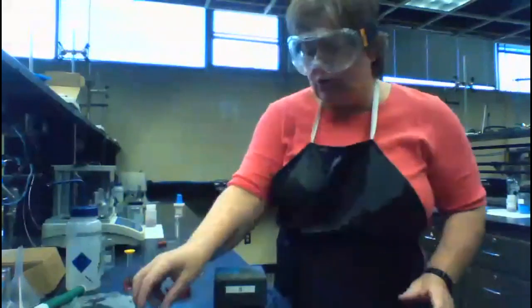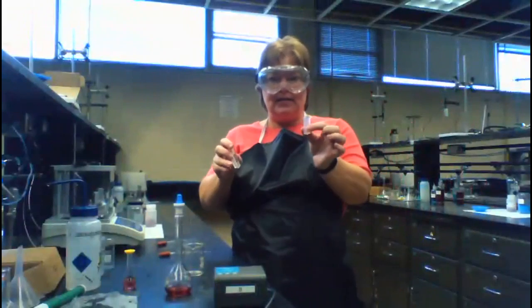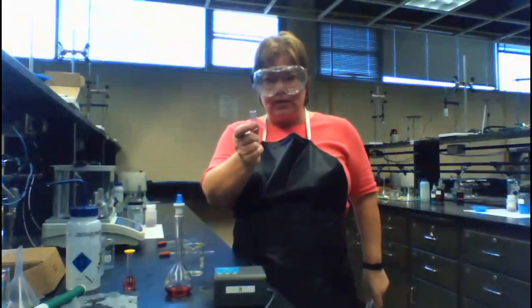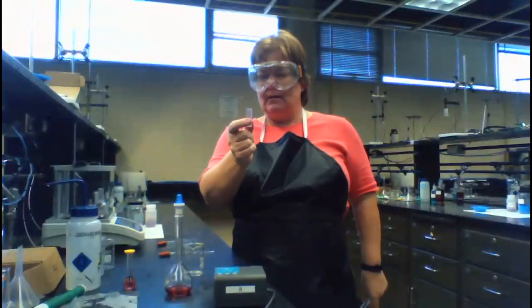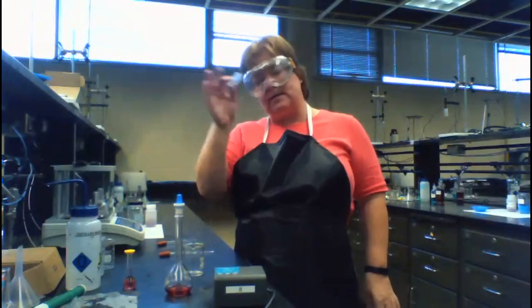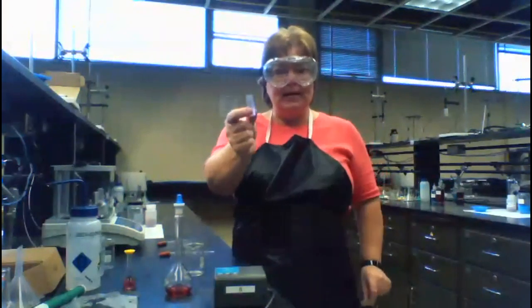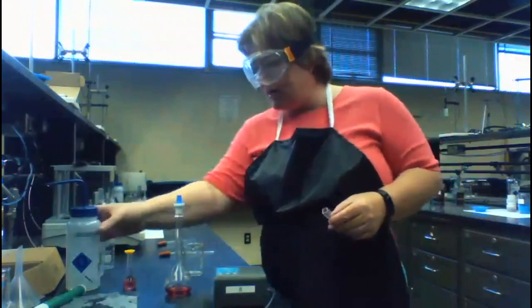For this part, we will use 2 cuvettes. Normally, we use 1 cuvette because this cuvette is not quite the same as this cuvette. I don't want to introduce extra error. I want to have fewer variables. So once I do the second part, I'm going to stick with the same cuvette, and I'm not going to empty solutions out. That's how I'll do it in the second part. For now, I'm going to put my stock solution in one, and I'm going to put water in the other. I want to fill it up.